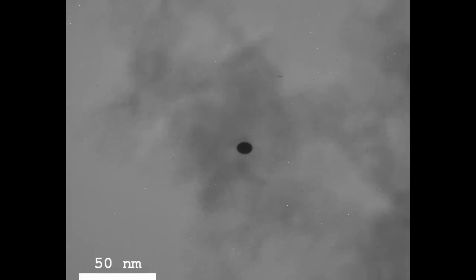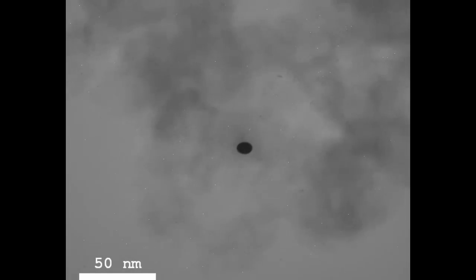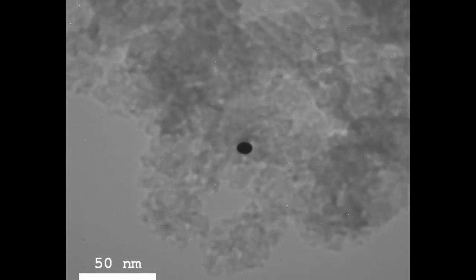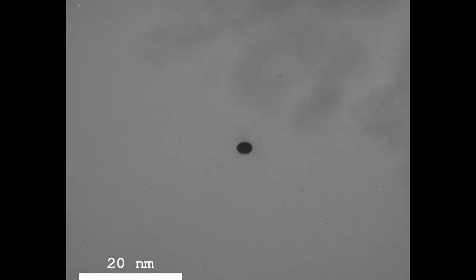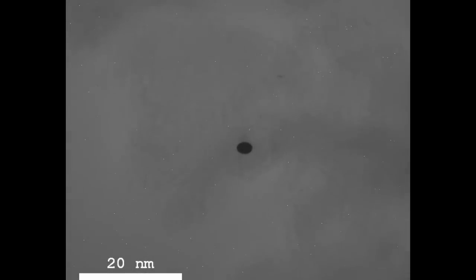One important thing to remember: the bright and dark regions in a phase contrast image do not directly reflect the particle positions. This is a phase contrast image — it is an interference effect of the electron beam. Depending on how you turn the focusing knob, atoms can appear either white or black. The only reliable way to interpret what's happening is to model the entire system, which can be very difficult, especially when combining several diffracted beams with the central beam or when the sample structure is complex.